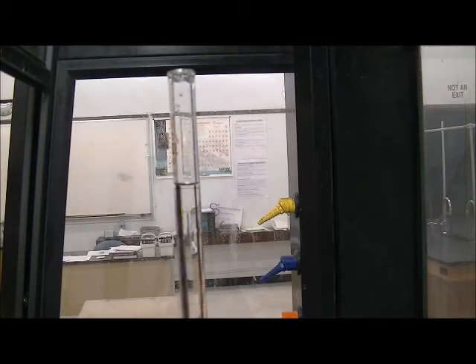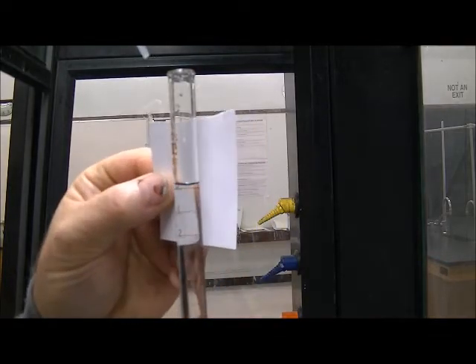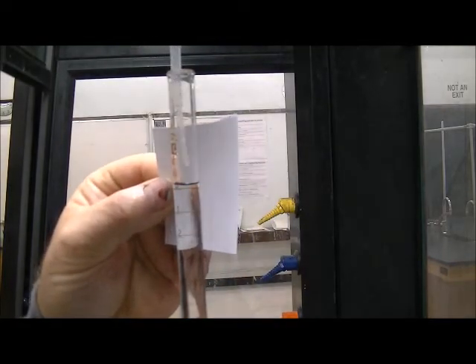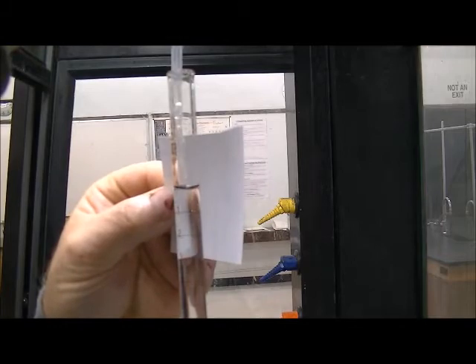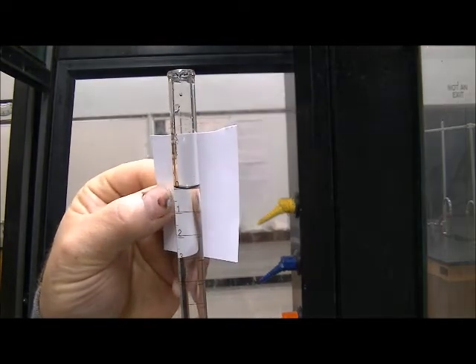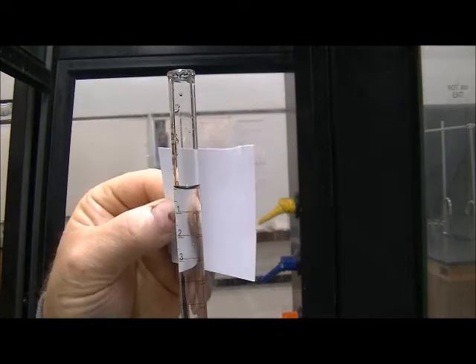I have filled my burette after rinsing it as we demonstrated in class. And now I'm adjusting to make sure it's right at the zero mark. That's the bottom of the meniscus. There it is, right there.